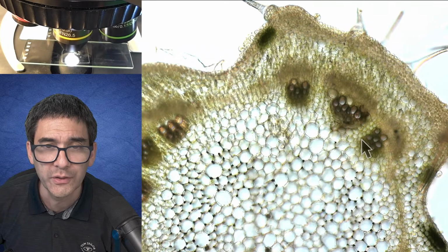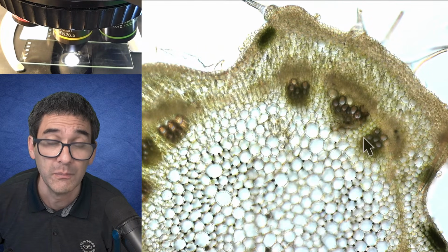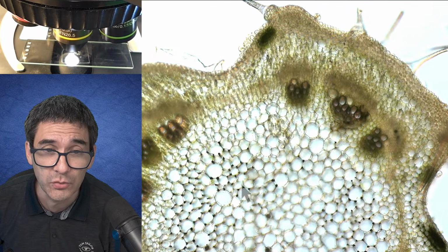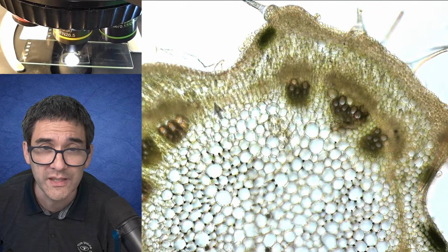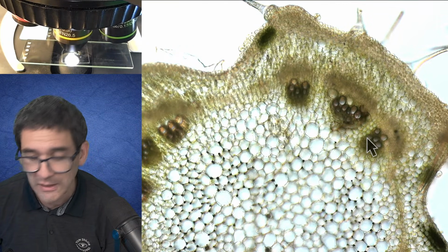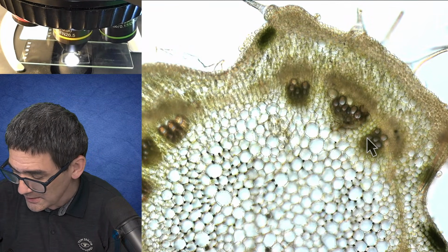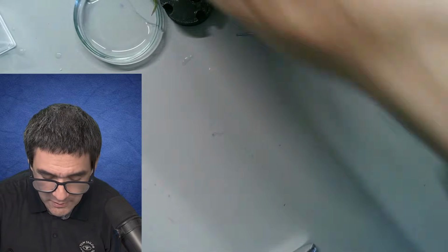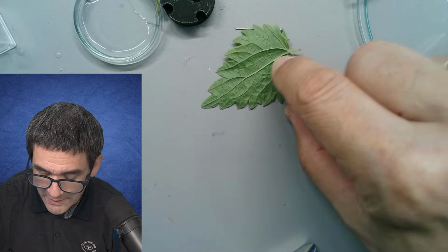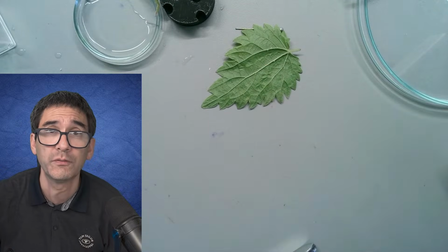While in a monocot, for example onions and lilies and so on, they have those vascular bundles distributed throughout the stem, and they're not arranged in this nice pattern. So that's one reason why it's a dicot. And yet another one, obviously, is over here. We just look at the vascular. You see, it's branched, right? That's also very typical of a dicot.